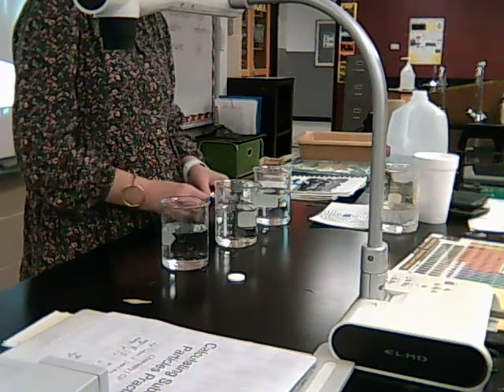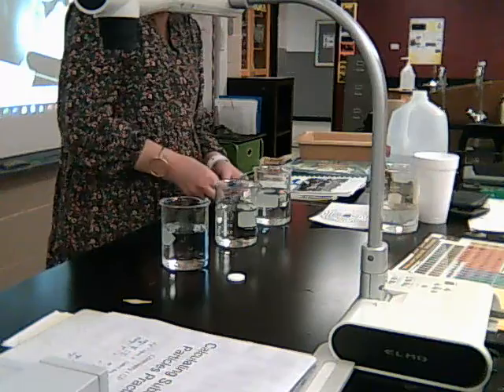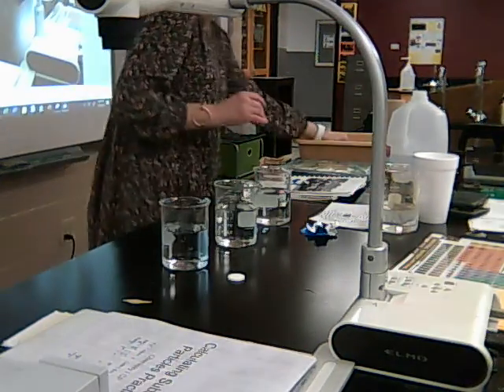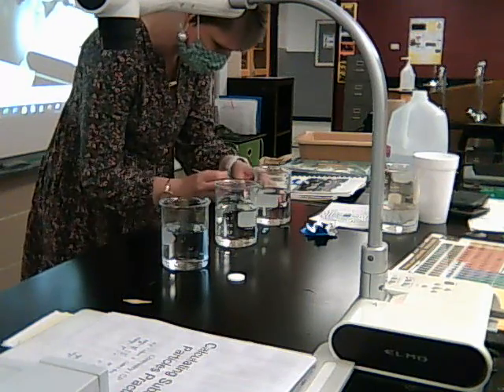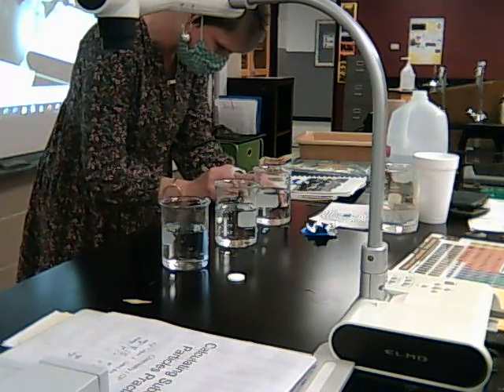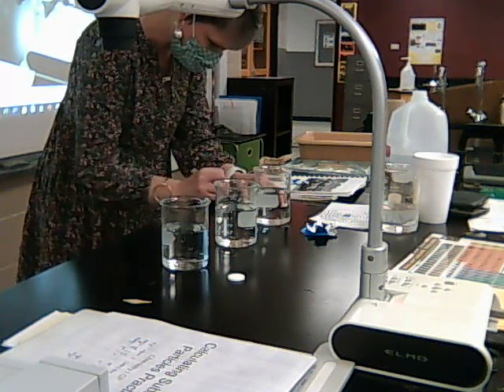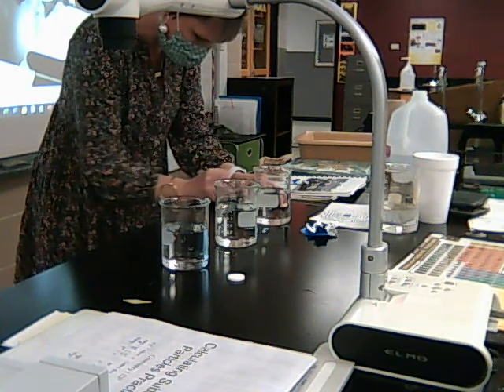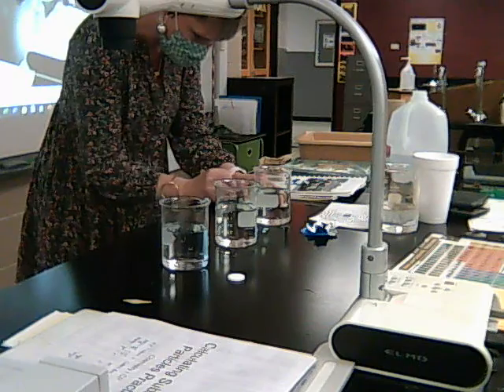Making sure to keep this an entire Alka-Seltzer, the same amount of Alka-Seltzer in every one. Let me get my little thing here and do a little bit of scratching on it to get this one in half. Again, I'm going to keep it on the paper so that I get the same amount in every one of them. I don't want to lose any.